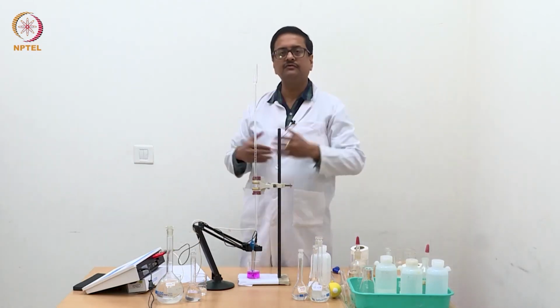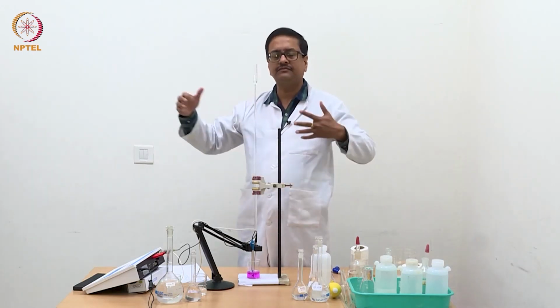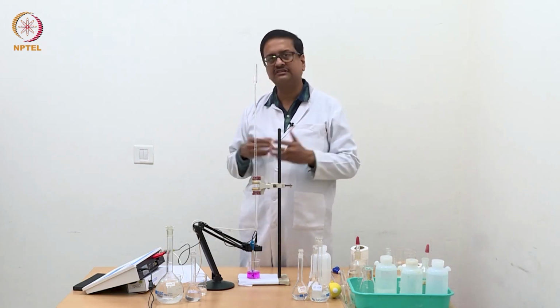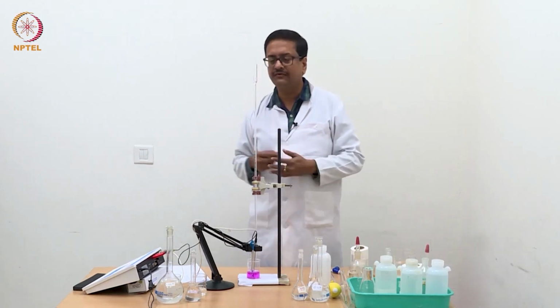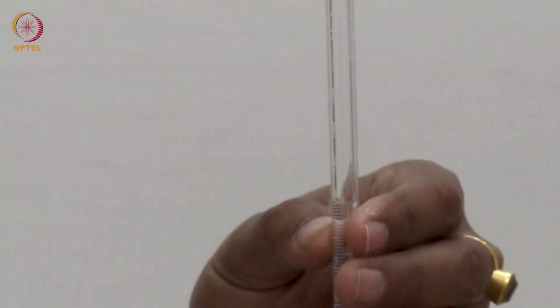So now after the equivalence point, I will need 3 or 4 points which are slightly away from the equivalence point. So what I will do is I will add 0.1 ml portions of NaOH each time, shake well and take the reading, and we will do it for 5 or 6 readings, that is up to 0.5 ml more.